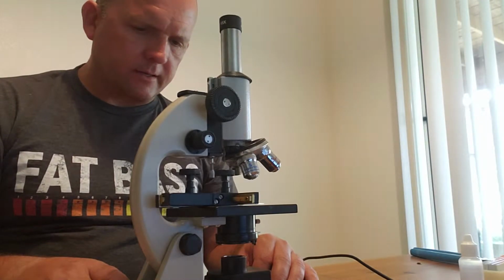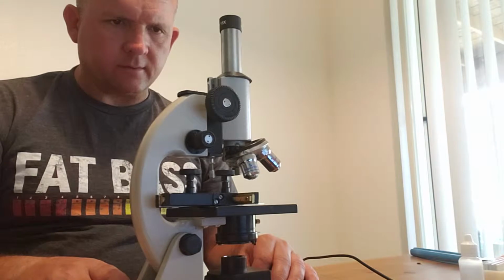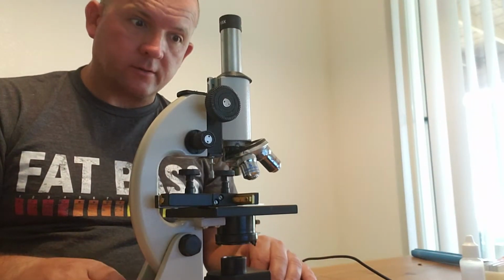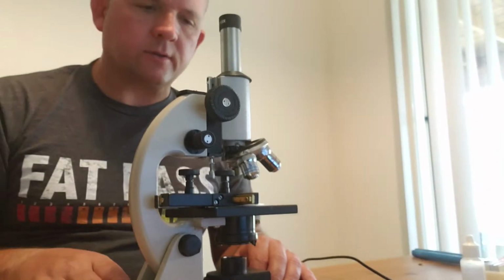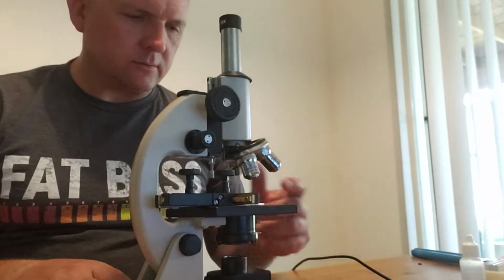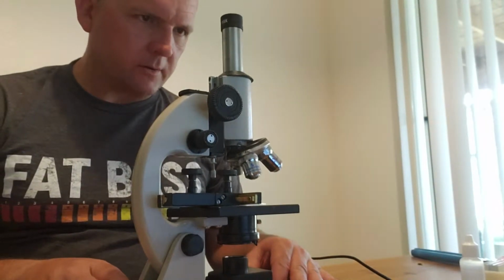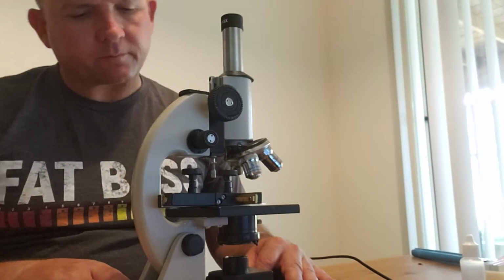I honestly didn't think I had to buy a microscope until my success coach told me, and I've never owned a microscope before, so this is all kind of new to me. I've used microscopes in the past between chemistry and anatomy and physiology, but to actually own one and use it for microbiology, it's been interesting. I started messing with it last night.